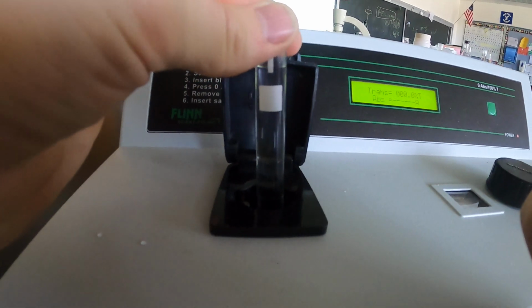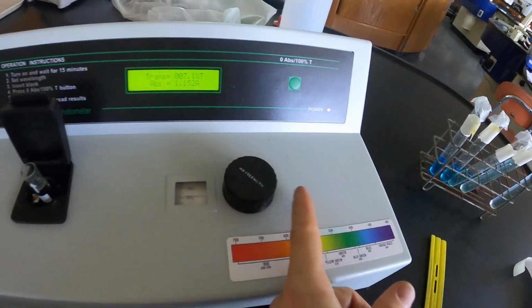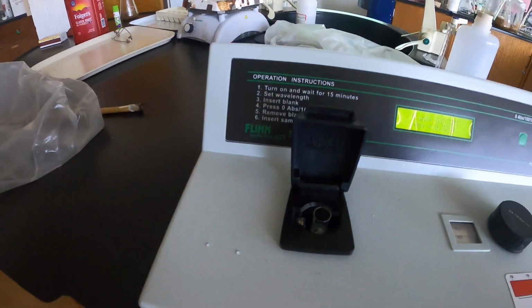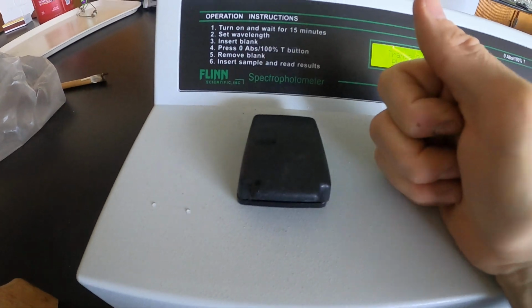This white square goes right on this line here, because the light is coming in from this direction and the detector is over here, right? So if you put this white square there, it's actually going to block out some of the light, and that's obviously an experimental issue. So you push this down. Please do not spill liquid in the holding vessel for the cuvette, and then you shut it.